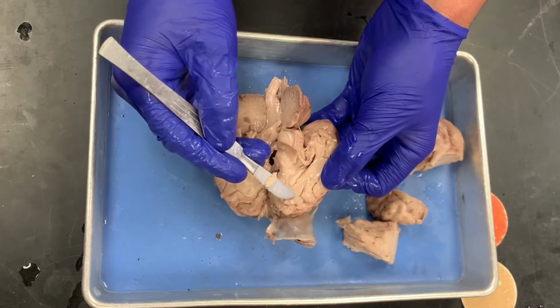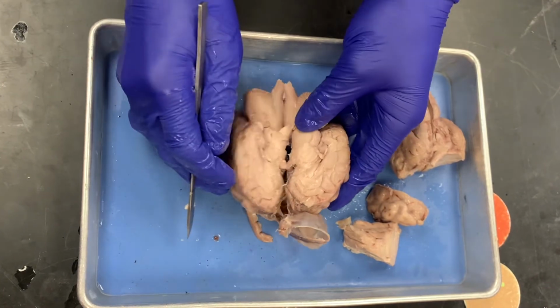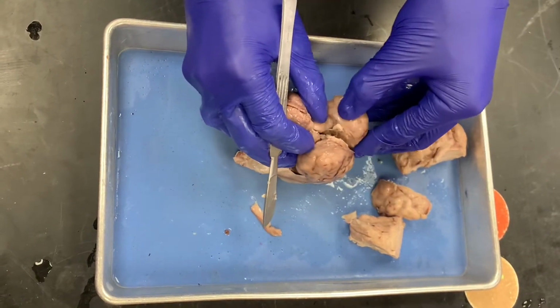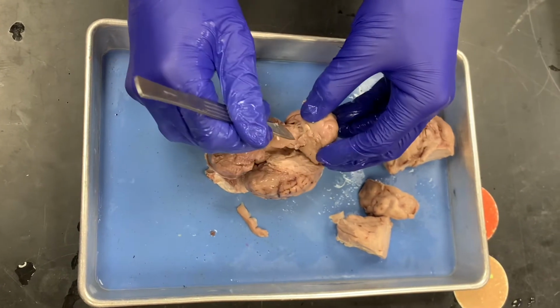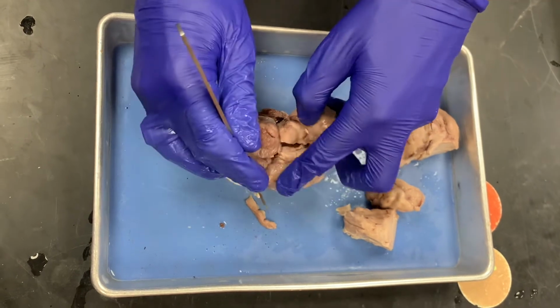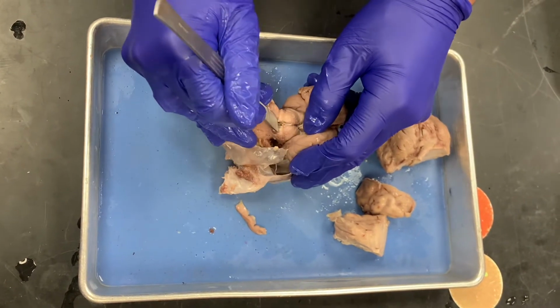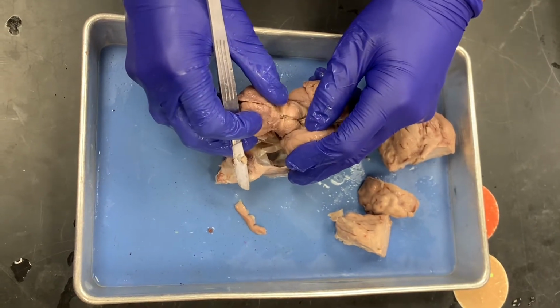You can also see the cingulate gyrus, which is right there. That's a component of the limbic system. So then if I put it back together, I want to show you a couple of different things. First off, we'll look at the thalamus. So the thalamus is here. That's this particular region. It's directly above the midbrain. So some of the particular structures of the midbrain: this is the superior colliculi on top, and then this is the inferior colliculi there on the bottom. So those 4, that's what makes up the corpora quadrigemina.